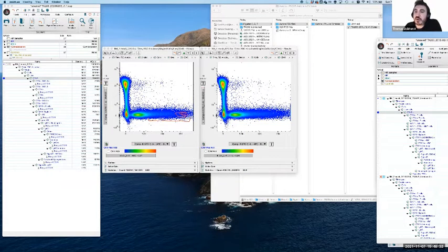Oh, that's when the linear. Oh, I see. Okay, I apologize. Well, just to make a point, the linear stuff for the top end of this thing, that absolutely can be helpful. I realize that wasn't the question in retrospect, so I suppose I don't need to go on about it. But the linear plots can actually be very informative.